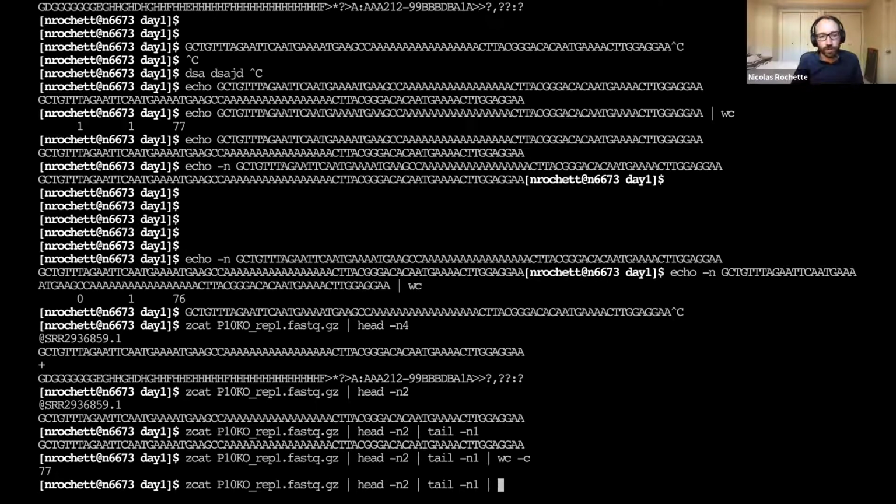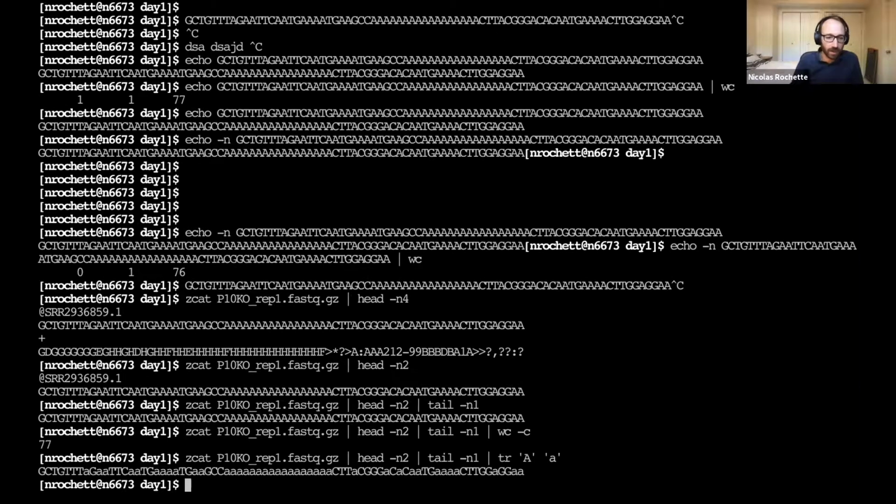One thing we can do also to remove this new line is using the tr command, which is I think transliterate. Anyways, tr command, and we can use it like this. So generally the tr command lets you convert one character to another character. So for instance, I could convert all the capital A's to lowercase a's. And now all my A's are lowercase. So this is the basic use of the tr command, but we can also use it to delete specific characters. And in this case, we can delete the new line character, which we can write like this with \n, and that means the new line character.